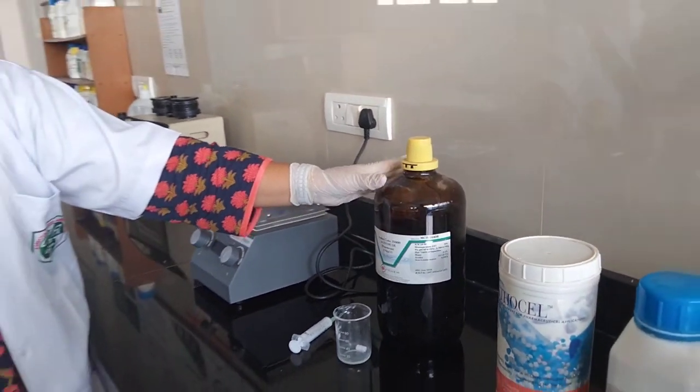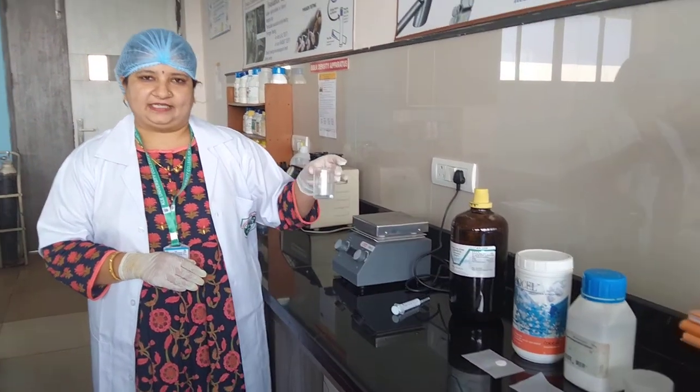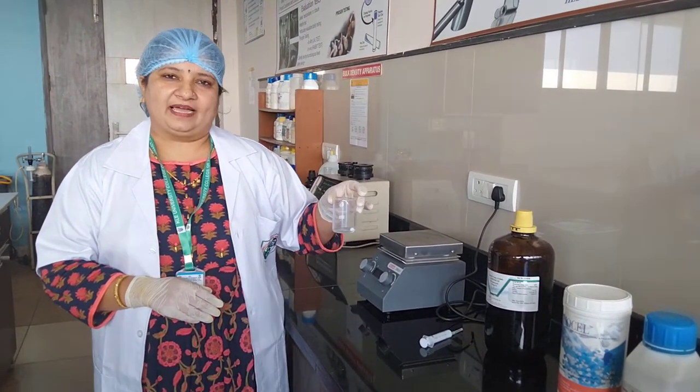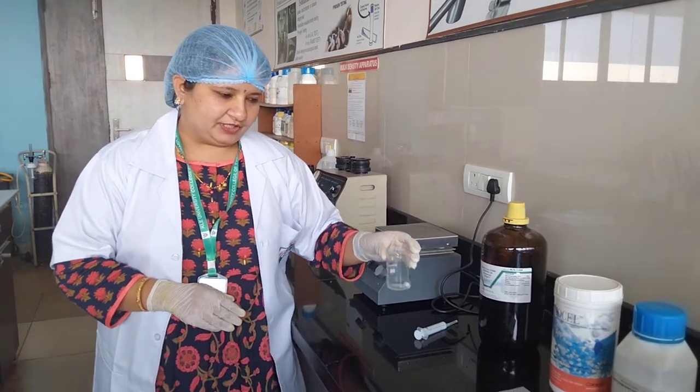The drug along with HPMC and ethyl cellulose will be dissolved in 10 ml of acetone and stirred on a magnetic stirrer. Let's start with the procedure.